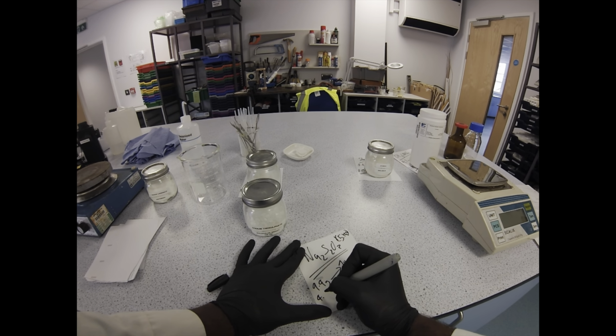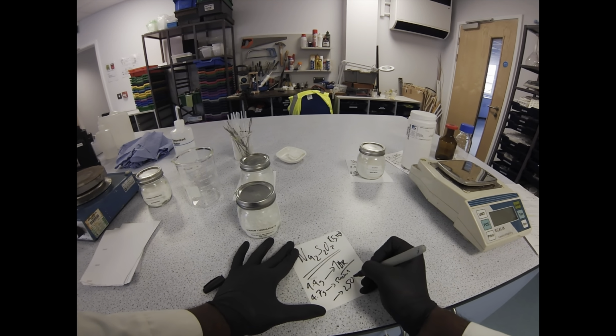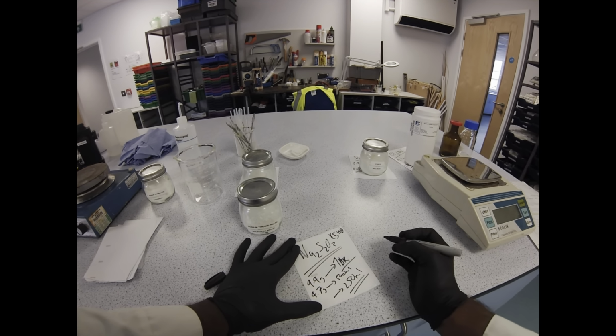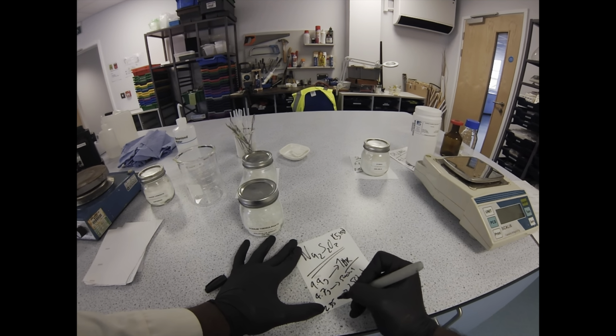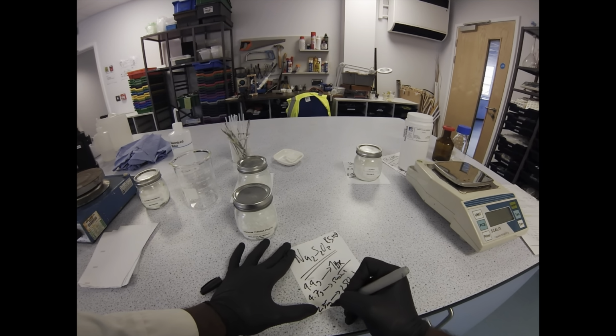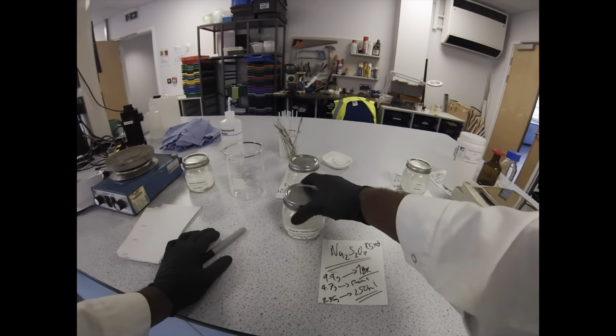This chemical is what's going to give us the time delay on our reaction, so we need to make sure that we do this correctly. You can adjust this to do all of those crazy variations where you see people point at it and it turns, or they go one after the other in succession.